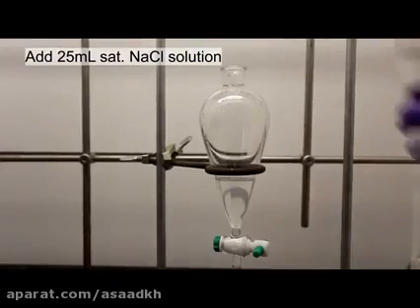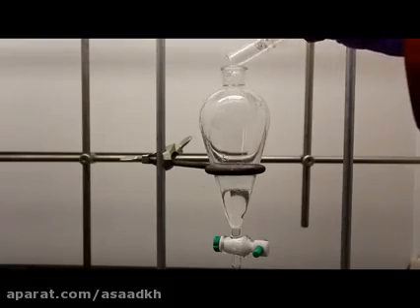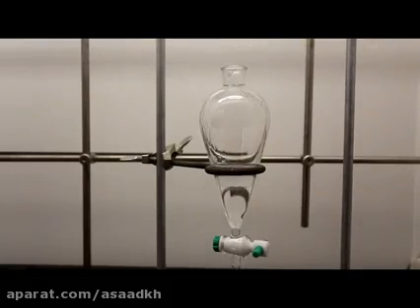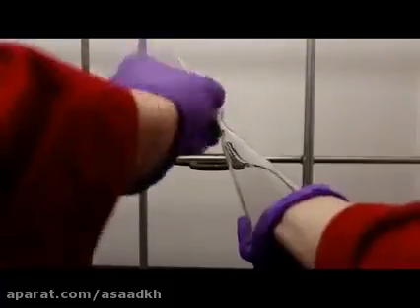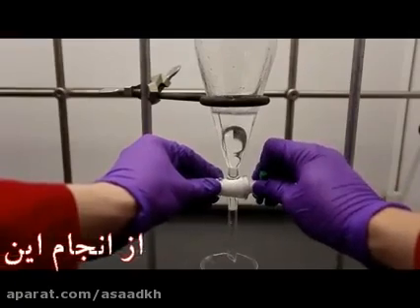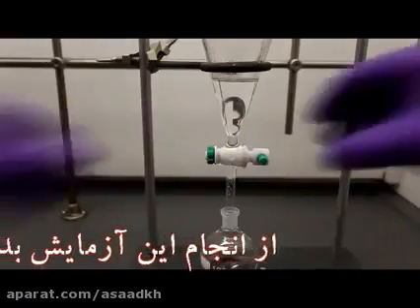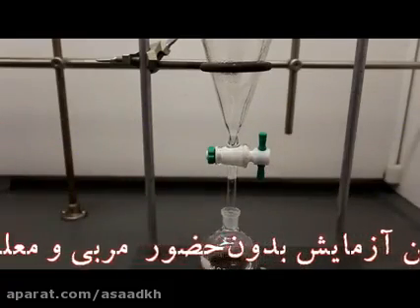Finally, the pentyl acetate is washed with 25 milliliters of saturated sodium chloride solution. After a thorough mixing, the layers separate and the sodium chloride solution is discarded. The saturated sodium chloride is used to dry the organic layer. The pentyl acetate was then drained into a 100 milliliter round bottom flask.